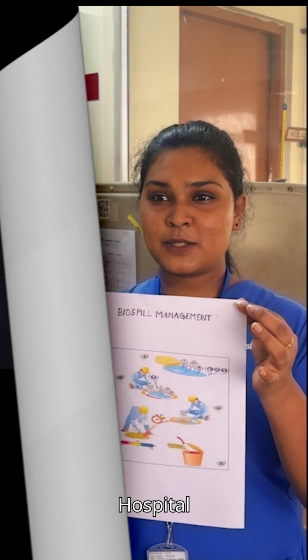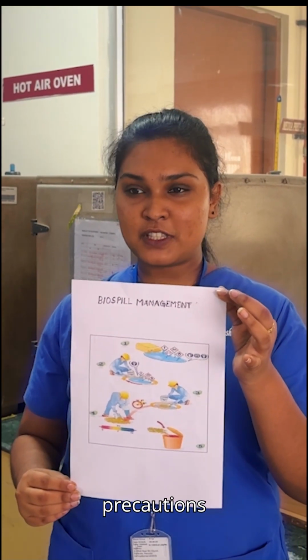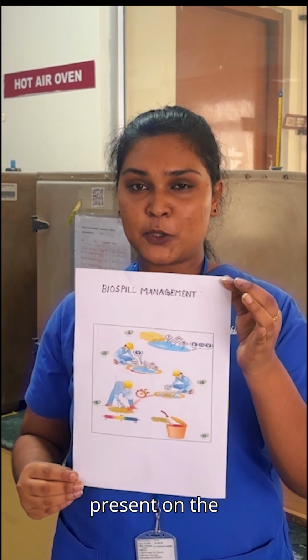Hello all. Hospital-acquired infection control. One among the universal standard precautions is biospill management. Today, we are going to present on the topic of biospill management.